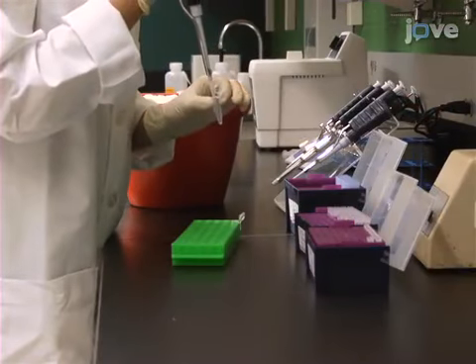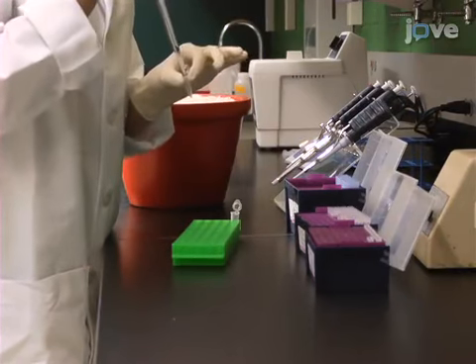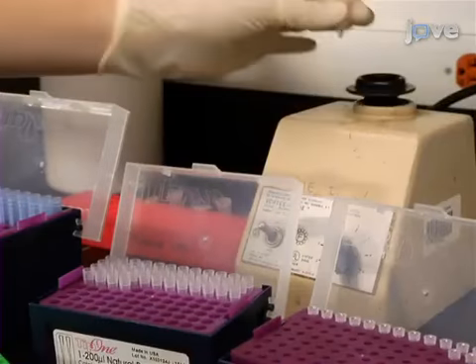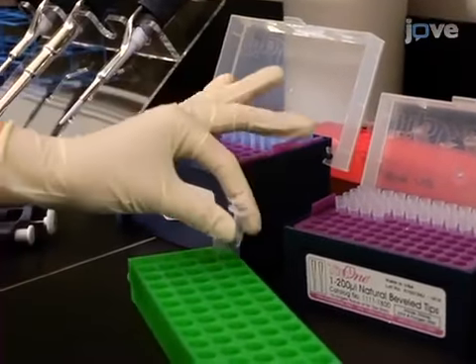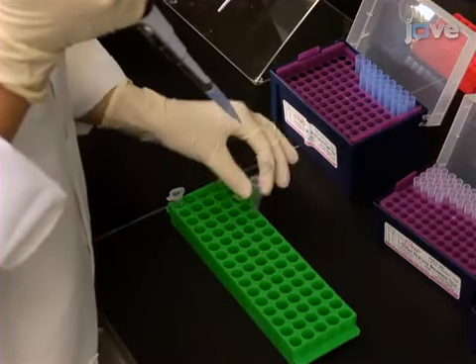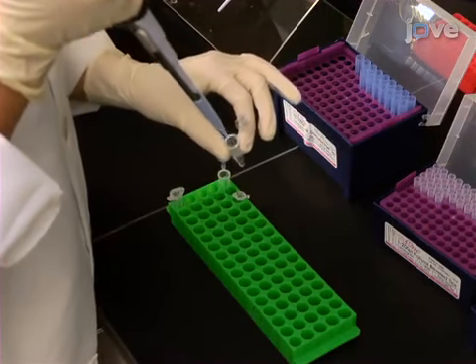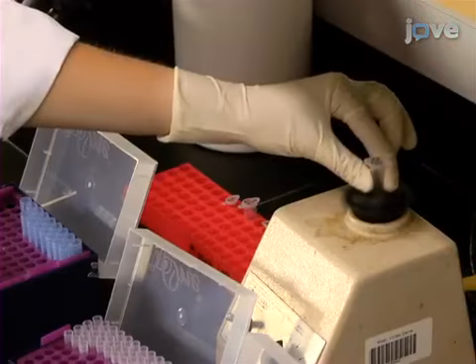Next, using the working assay buffer, prepare 40 microliters of biotin BSA buffer by combining sterile filtered biotinylated bovine serum albumin at 2 mg per milliliter with the working assay buffer in a 1:1 ratio and mixing the solution. Then, prepare the BSA buffer by combining 645 microliters of assay buffer with 5.5 microliters of 117 mg per milliliter BSA and mixing the solution.